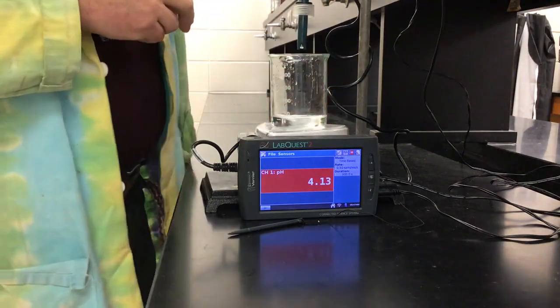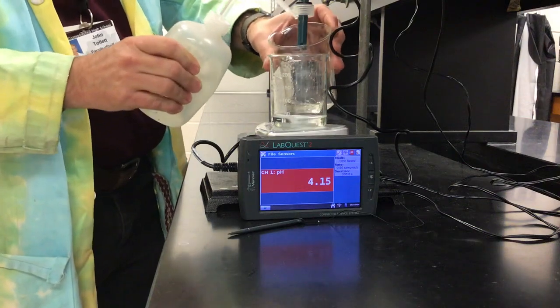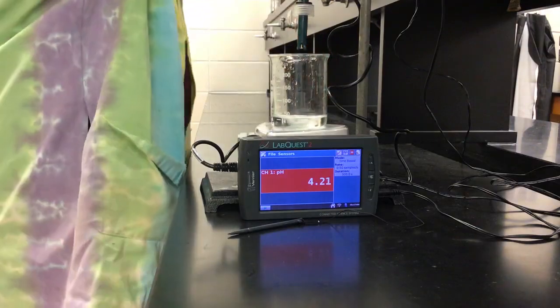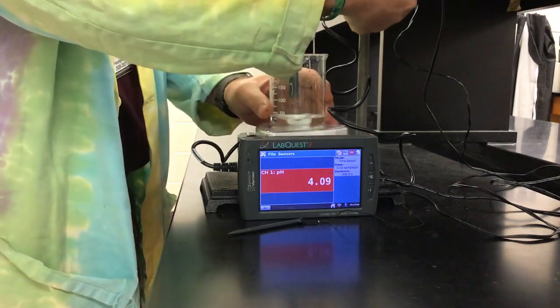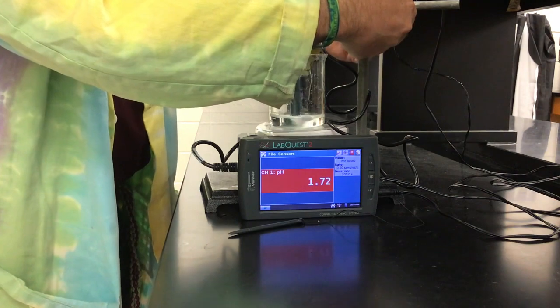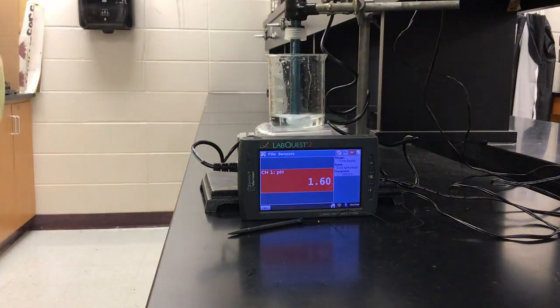Now, in order to do this, I've got to wash the probe a little bit. I had it sitting in a buffer solution of pH of about 4. I'm going to lower this down into the solution so we can use it for the experiment. I don't want to have it hit the magnetic stir bar though. It's important if you guys come back to school and you're doing these labs. You don't want to whack that pH probe, really thin glass membrane, with the magnetic stir bar. That would not be good.